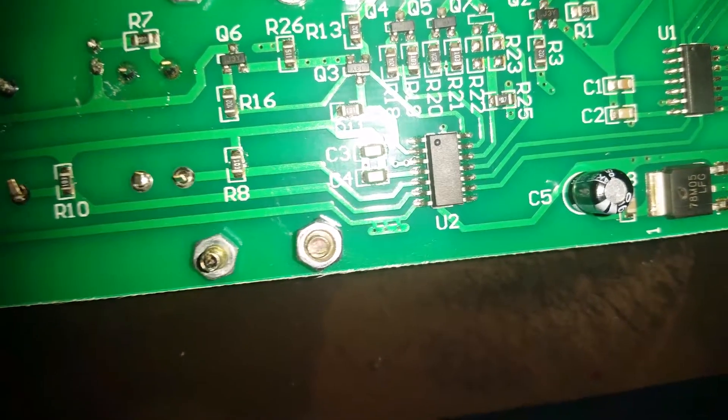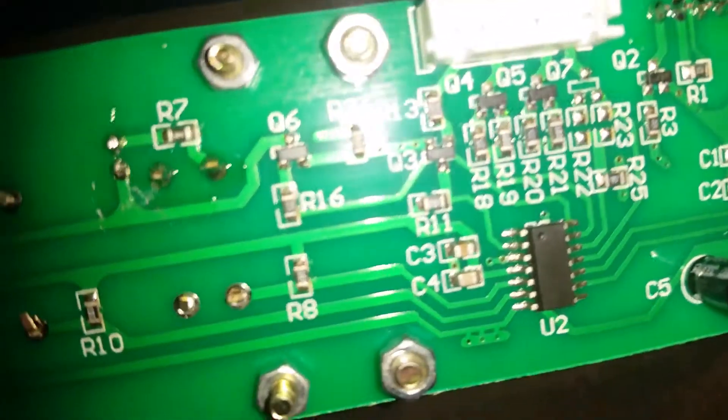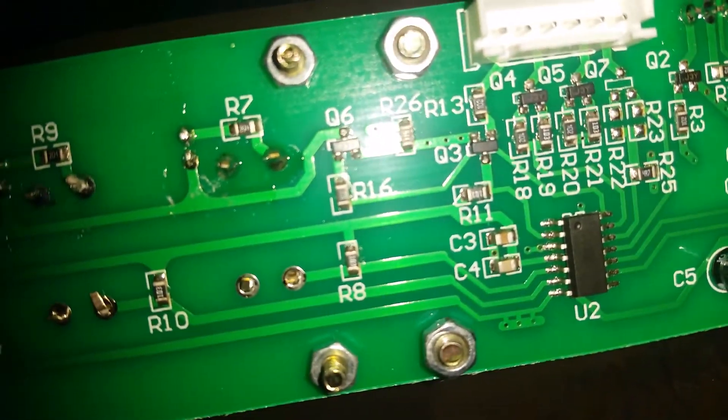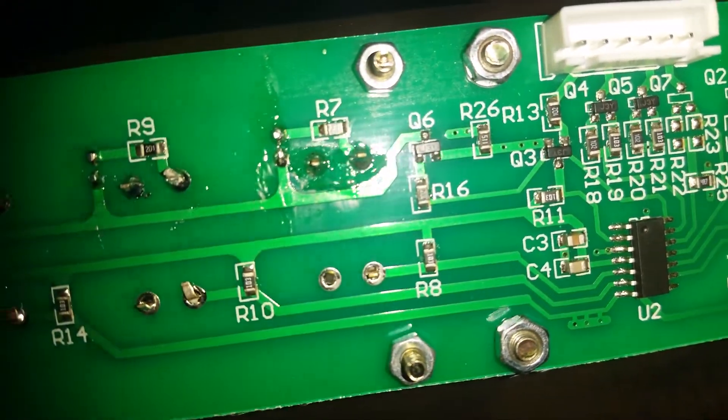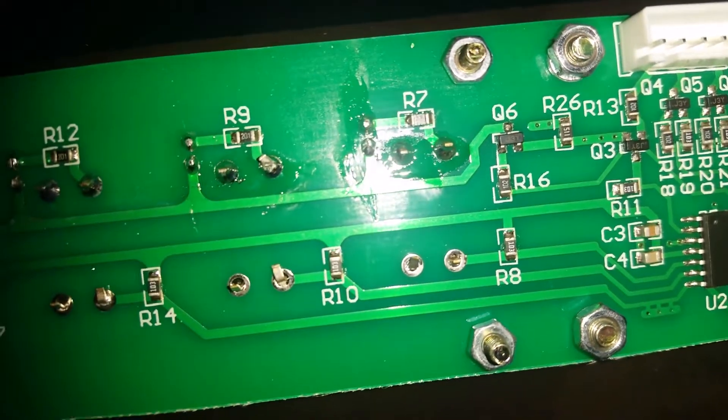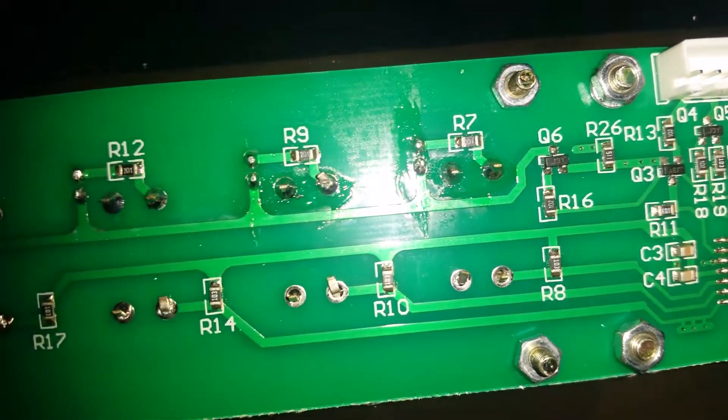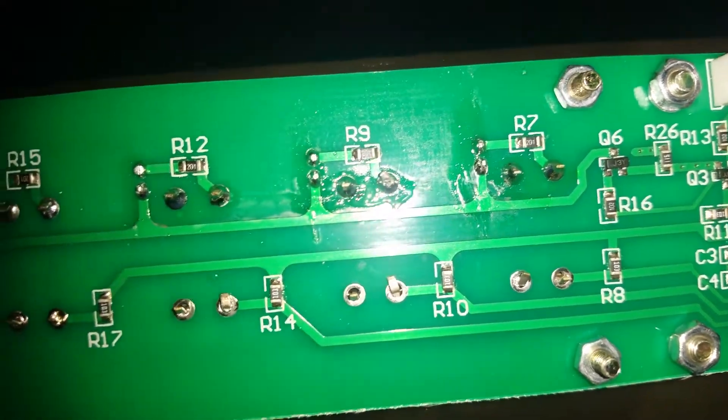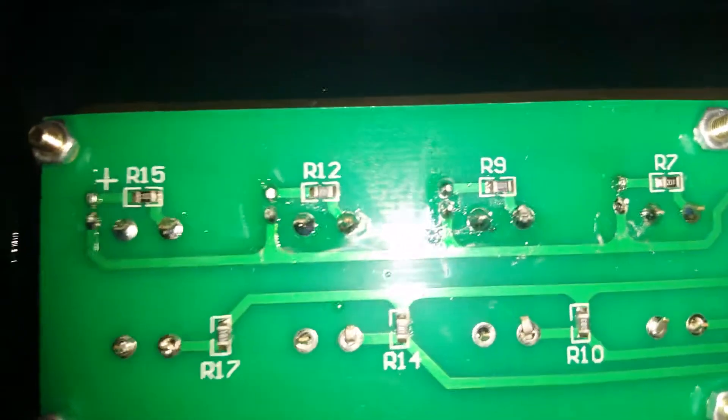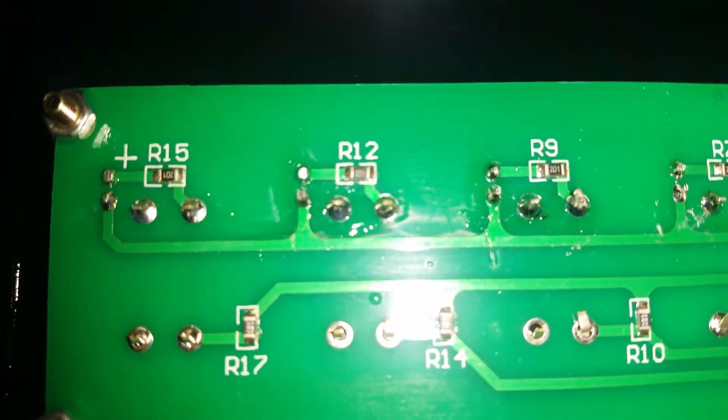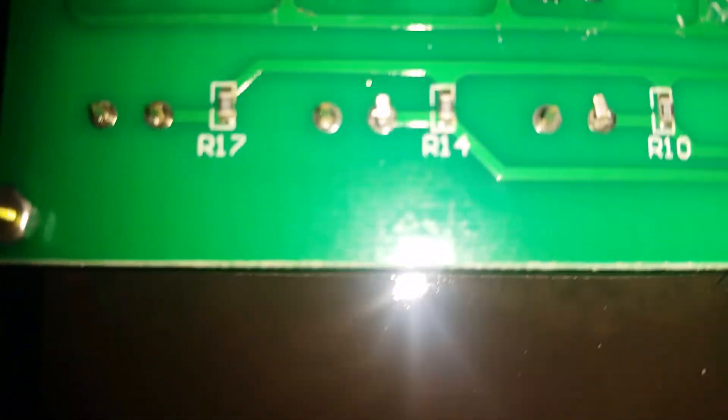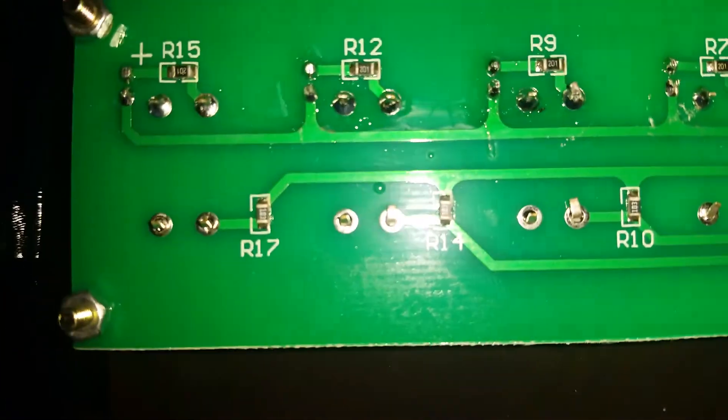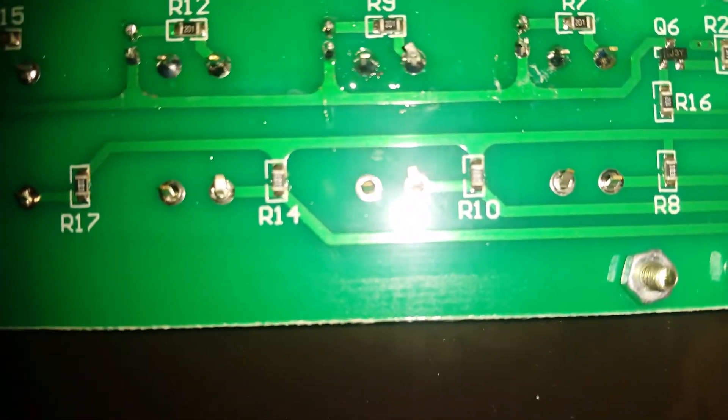R8, look at those. No solder at all. I did find a few trace pieces of solder just drips around on this circuit board. Didn't appear to be any bridges anywhere. But no wonder this thing isn't working properly.